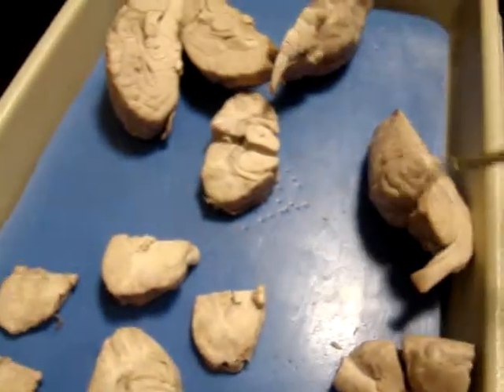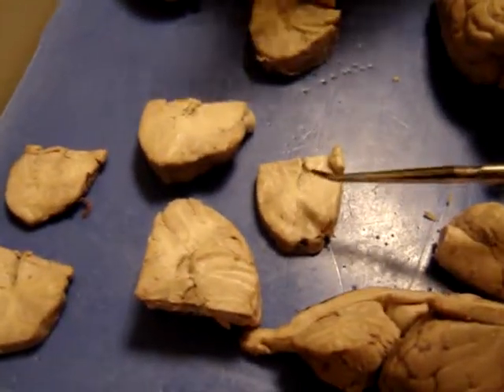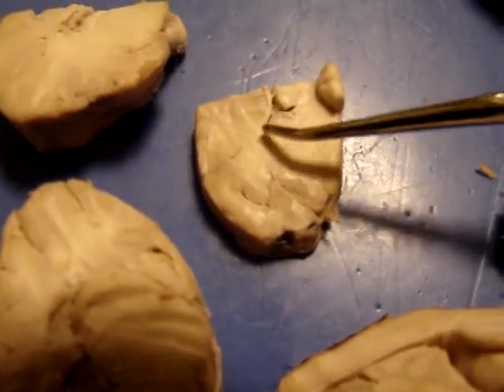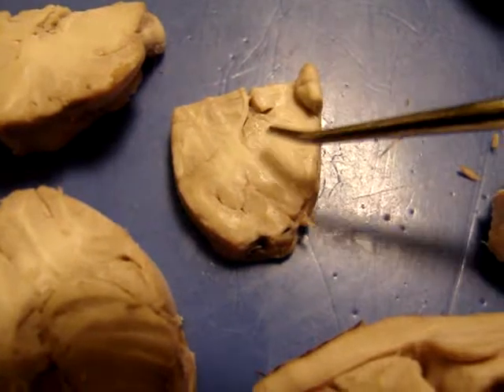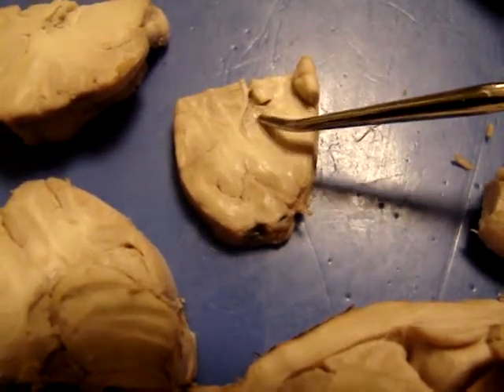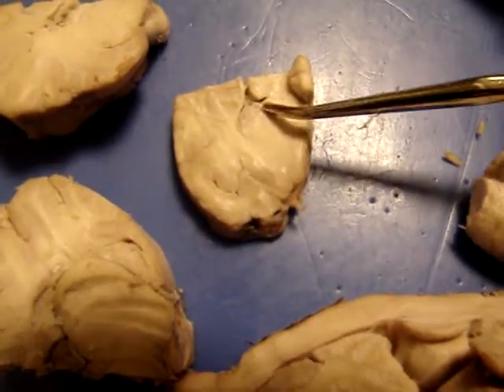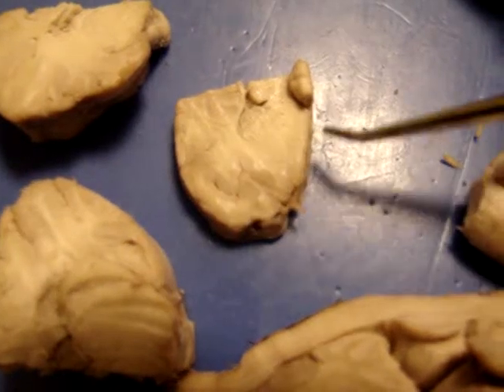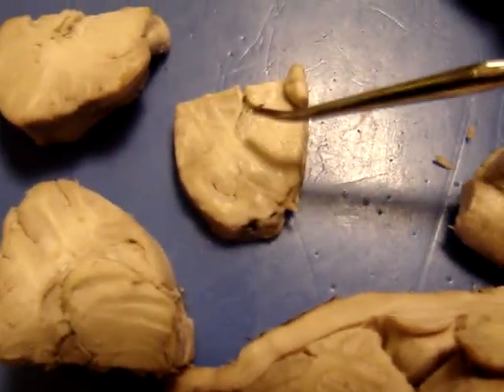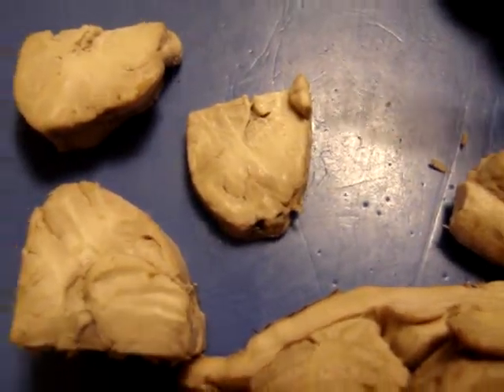Can you point that out? Sure. So, let's see. See this little structure right here? So here's lateral ventricle, corpus callosum. You see this dark nuclei right in here? Those are the basal ganglia. So there's a cut that goes right there. See how dark it is? So it's nice, deep gray cerebral nuclei, the basal ganglia. So we have the cortical gray matter on the outside, the white matter on the inside, and then that's the basal ganglia. There's 3 sets of nuclei or structures, but that's the one that we can see clearly here.